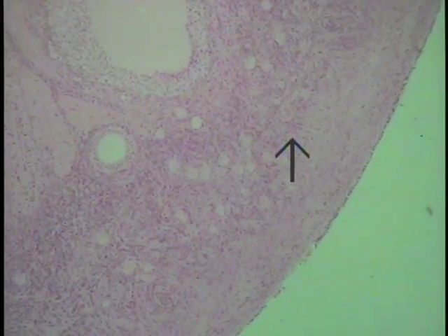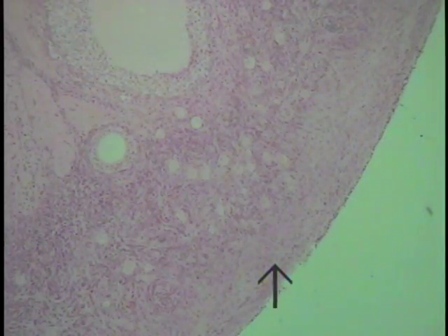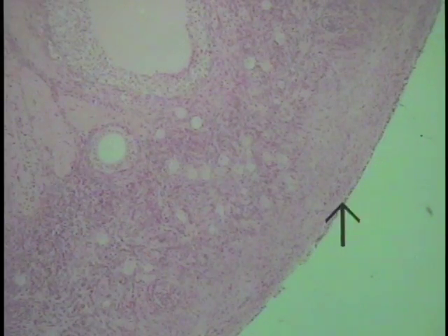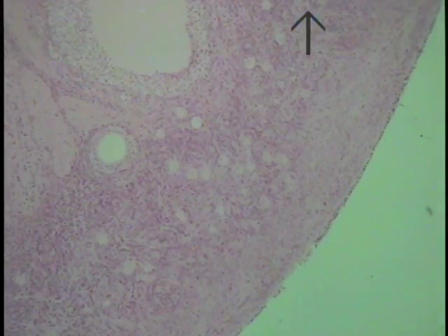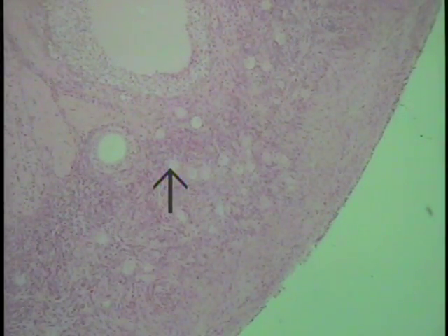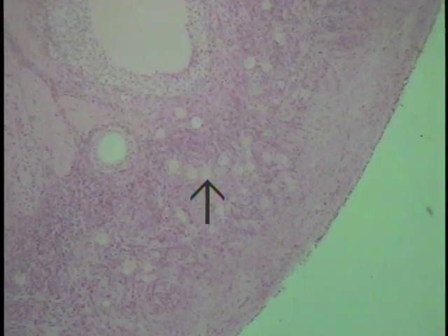This is a section of the ovary. This is the external boundary of the ovary on this particular section, located and indicated by the arrow. If one proceeds into the cortical region of the ovary, a narrow band of cells can be found. These are the ova — extraordinarily large spherical cells, as indicated at the tip of the pointer.